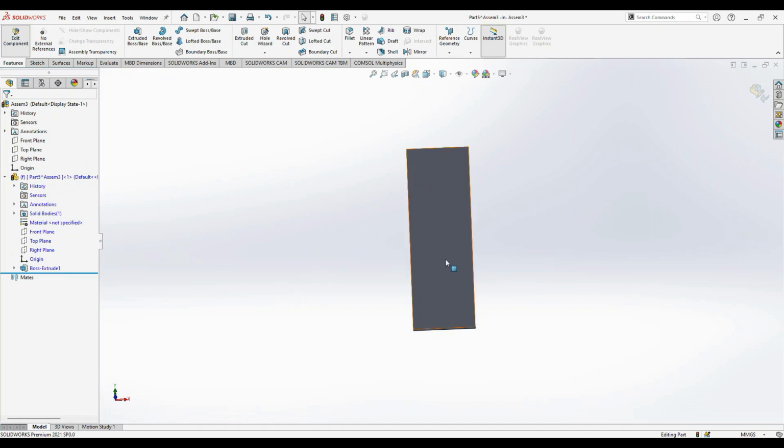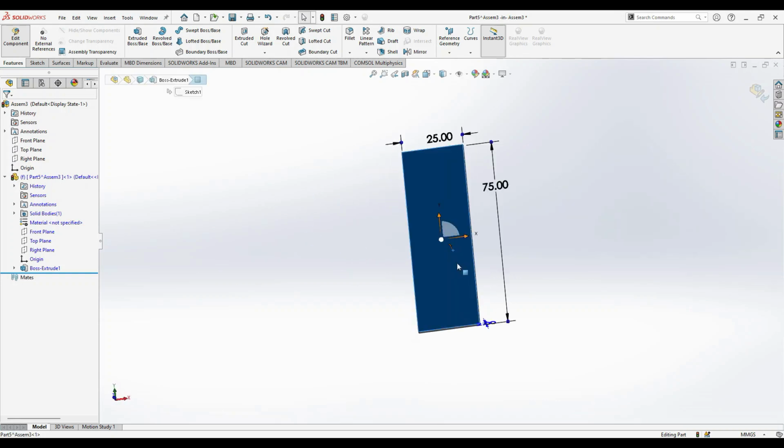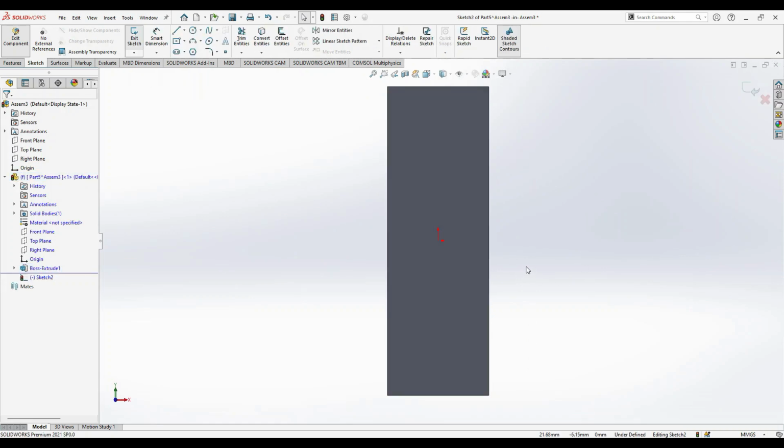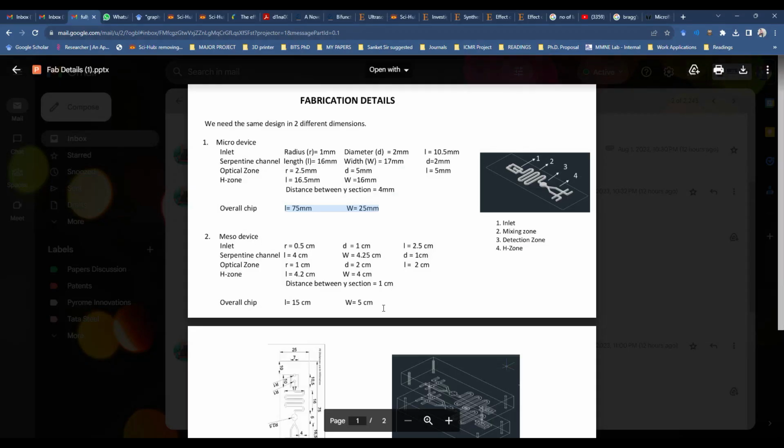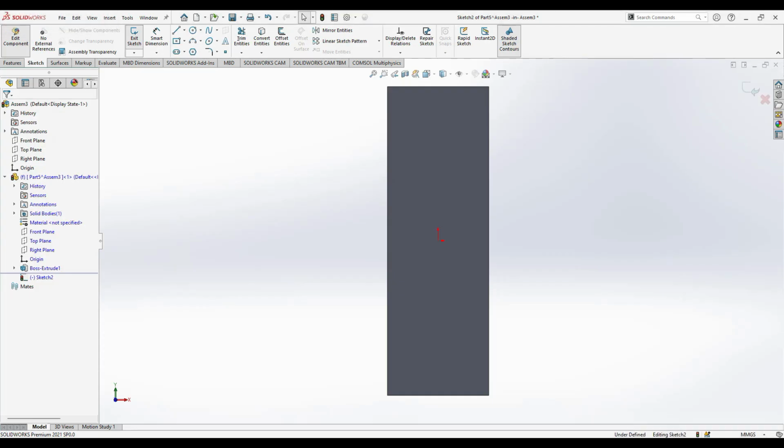After that, on the top of this, we'll be creating the microfluidic design. To do that, you can just click on this, go to sketch, and here we have a design of this kind. So we have an inlet radius, diameter and length, a serpentine channel length, width and diameter, and the optical zone, zone 3, and the H-zone. This is the final zone. Okay, from the design, now we'll go to draw the inlet, that is the starting of the design.